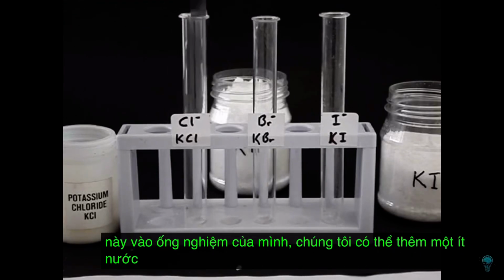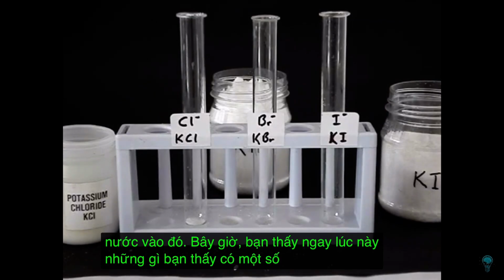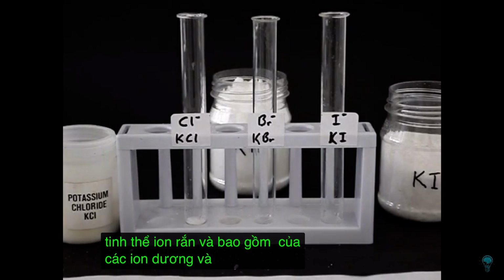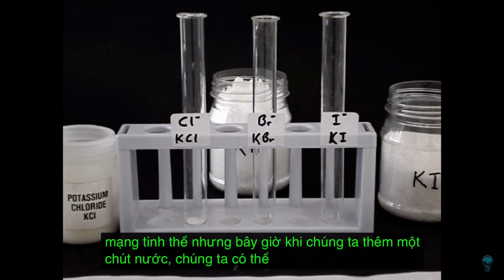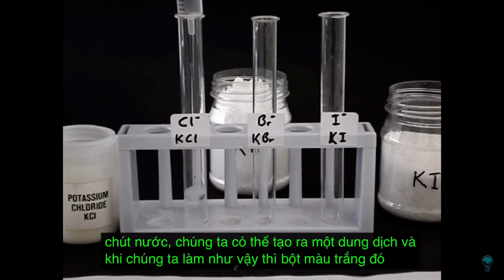We can add some water to it. Now you see, at the moment, what you see there is some solid ionic crystal, and that consists of positive and negative ions rigidly packed in a crystal lattice. But now when we add a bit of water, we can make a solution. And when we do so, then that white powder dissolves.